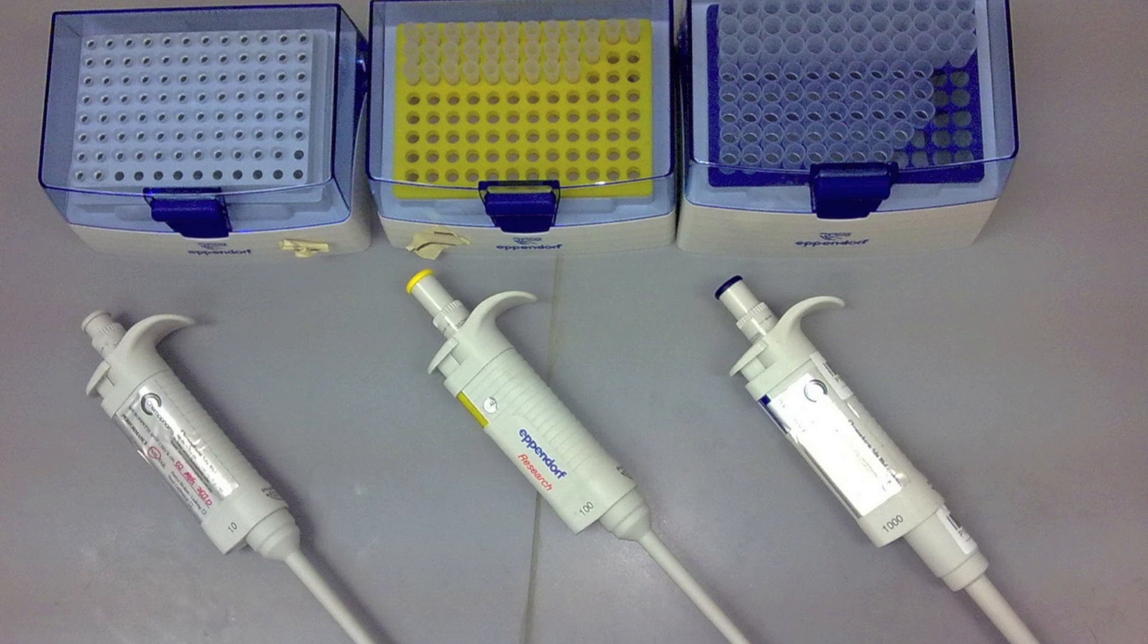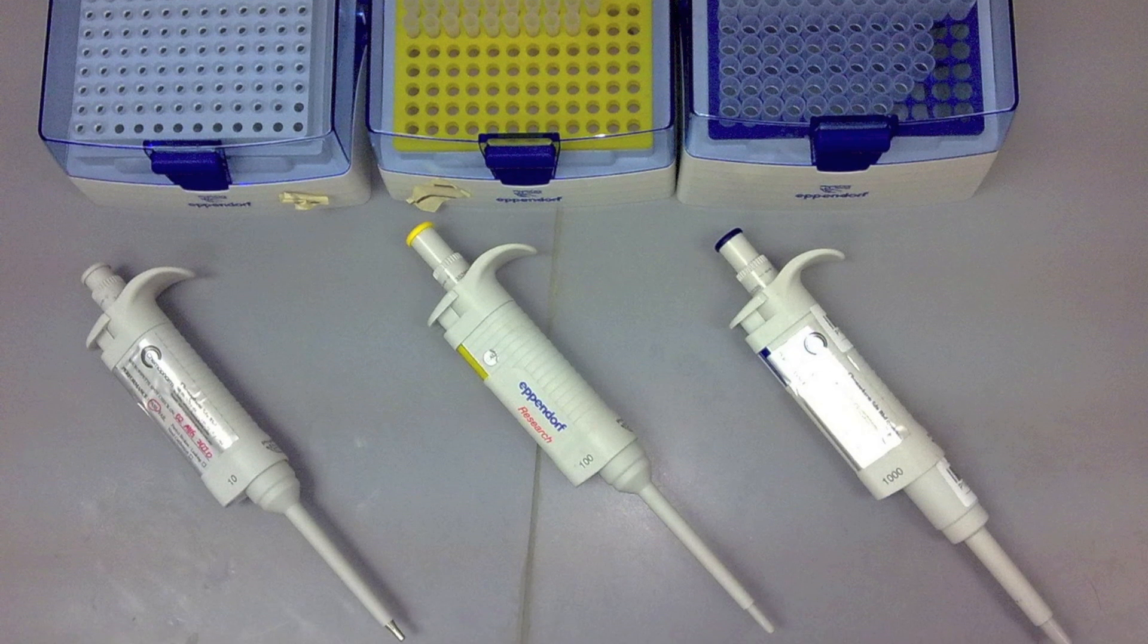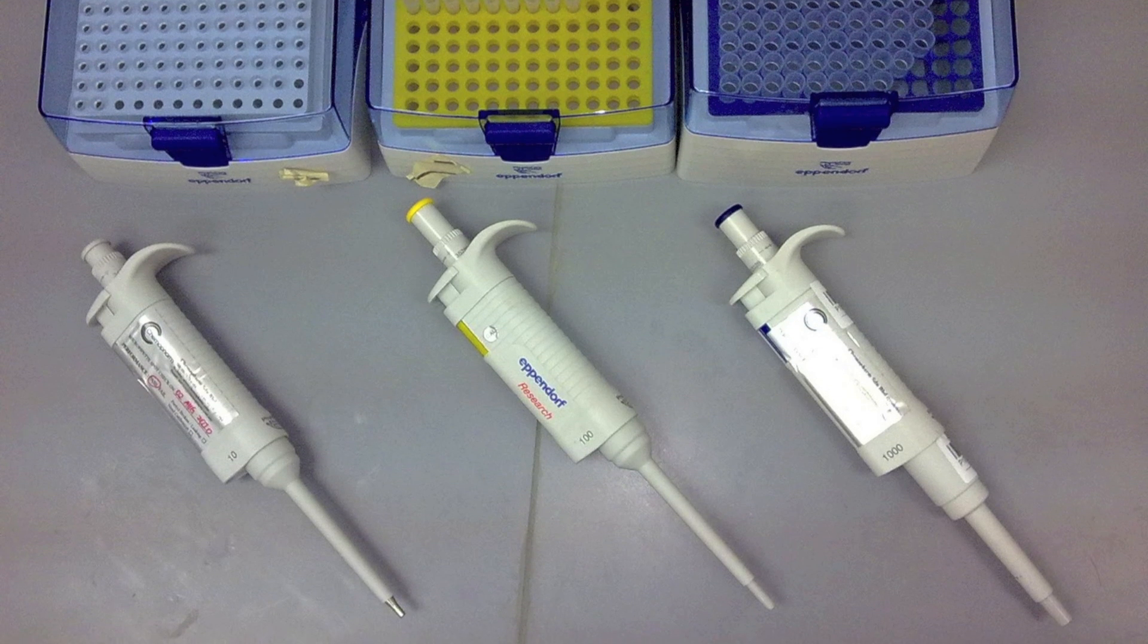Hi everybody! In this video, we will be showing you how to use the micropipette. A micropipette is used to transfer volumes less than 1 milliliter.